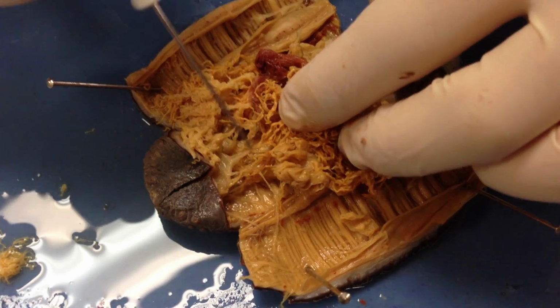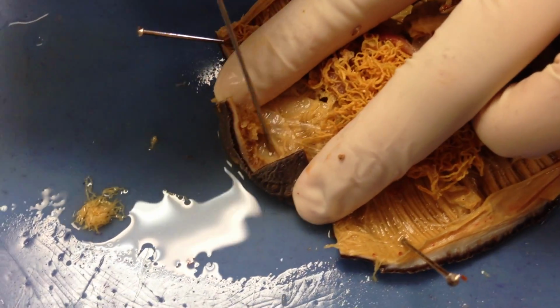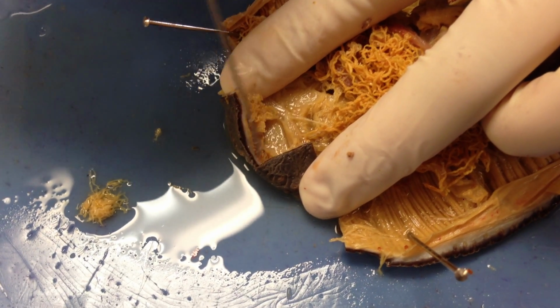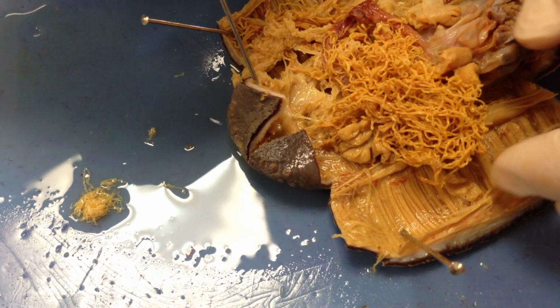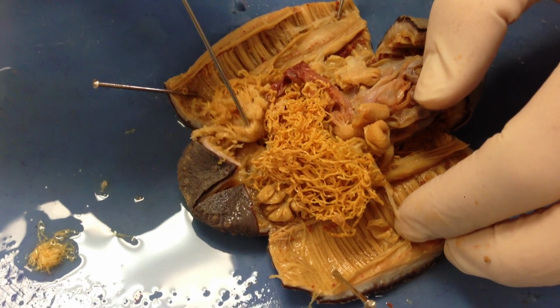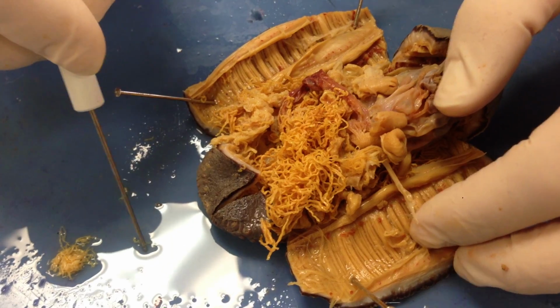If we go back to the intestines and we were to follow it all the way down, it's going to empty, of course, down into the anus, which down here is where all of the gametes for reproduction are going to exit. You also have the opportunity for these organisms to do evisceration, which is when they release respiratory tree and some of their gonads to save themselves from a predator. I think that's it.